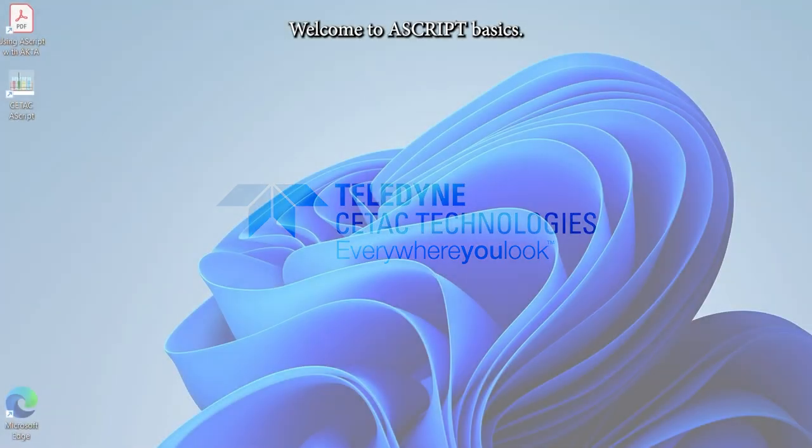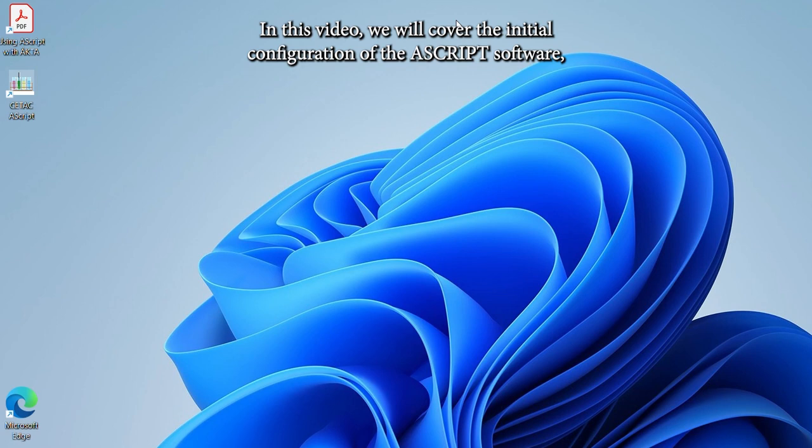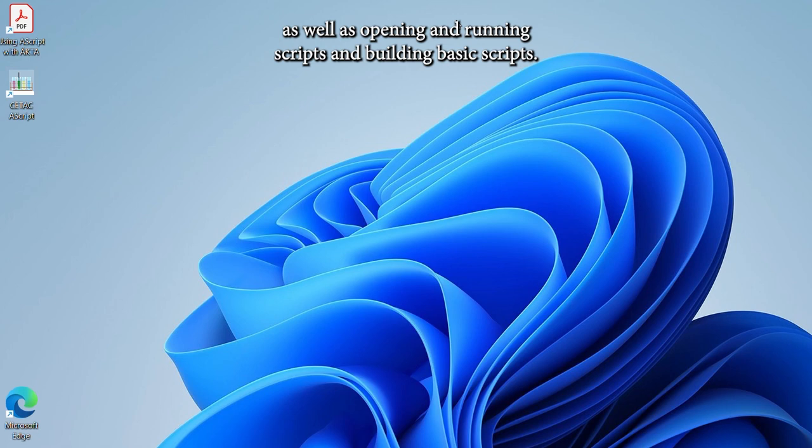Welcome to ASCRIPT Basics. In this video, we will cover the initial configuration of the ASCRIPT software, as well as opening and running scripts and building basic scripts.